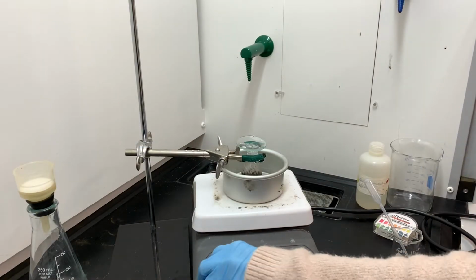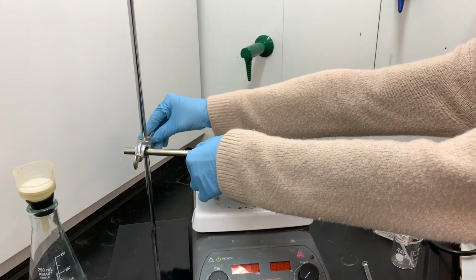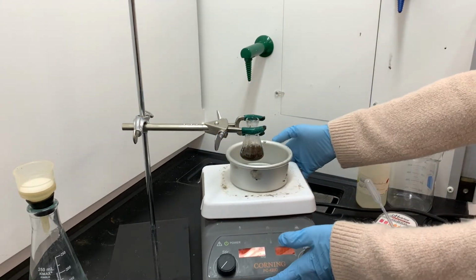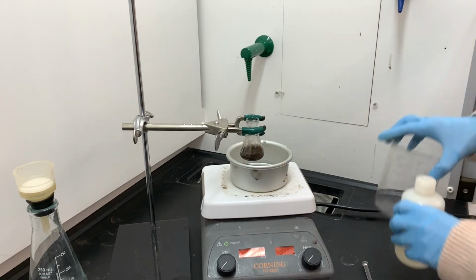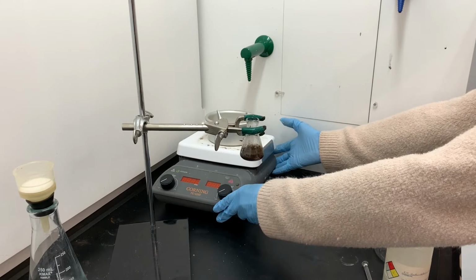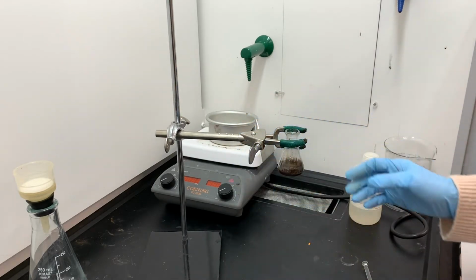This has been reacting in the boiling water bath for about 15 minutes. This first step of the process has just been to convert the side chain alkyl group into a COO- group. And so what I have inside that little flask right now is basically a deprotonated carboxylic acid, just a COO-. And what I'm doing now is getting ready to perform the second step of the reaction. The second step is where I'm using hydrochloric acid, HCl, to protonate that COO- group to make the benzoic acid.